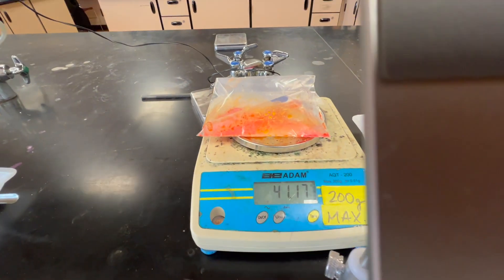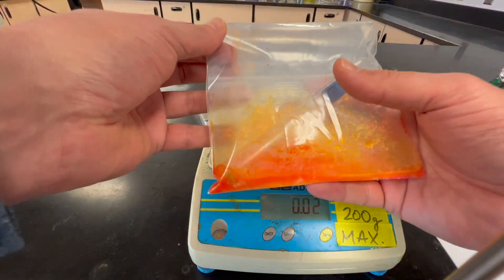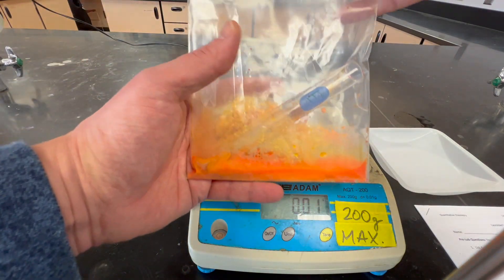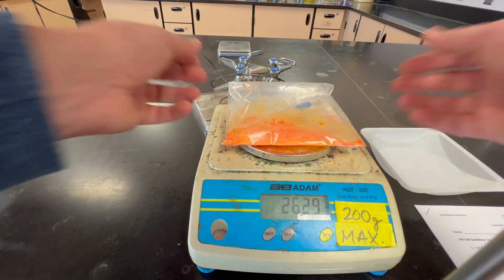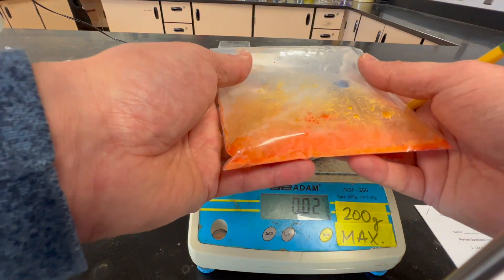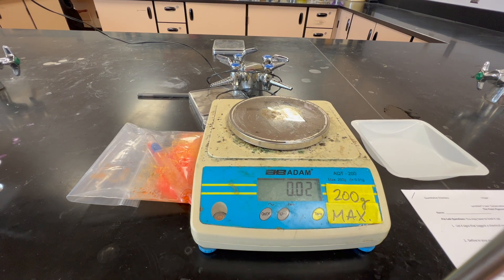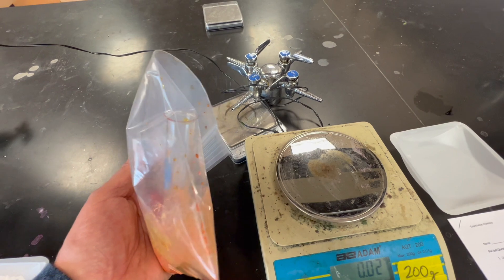Now we can observe this chemical reaction. If you recall at the very beginning, the bag was still cold. We were also careful to squeeze out all of the air out of the bag. We now have all of the information we need to complete part one, and you can see why it was important to do this chemical reaction in a closed system.